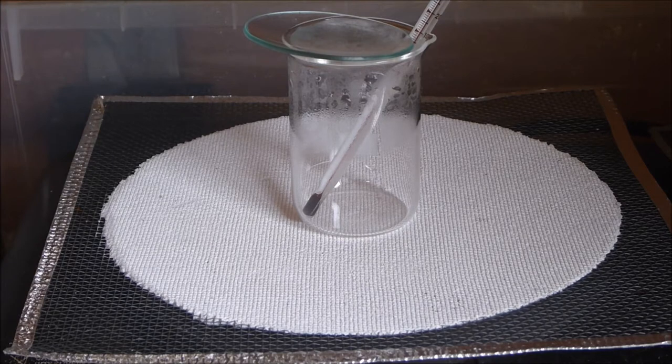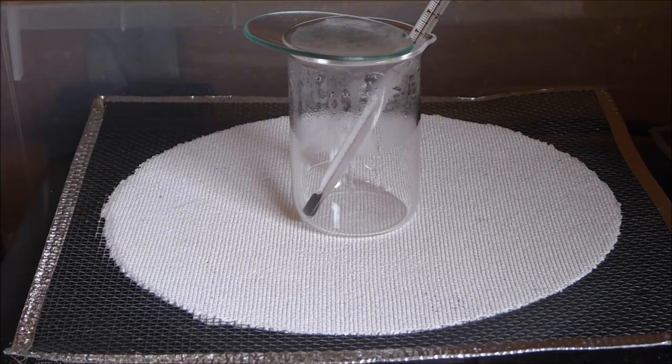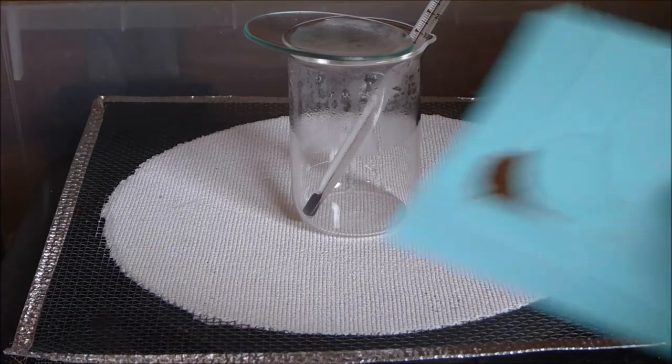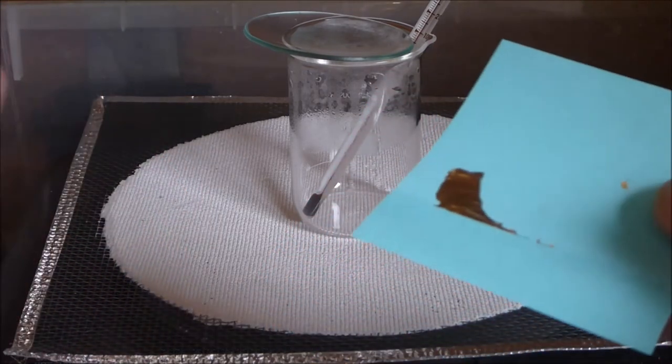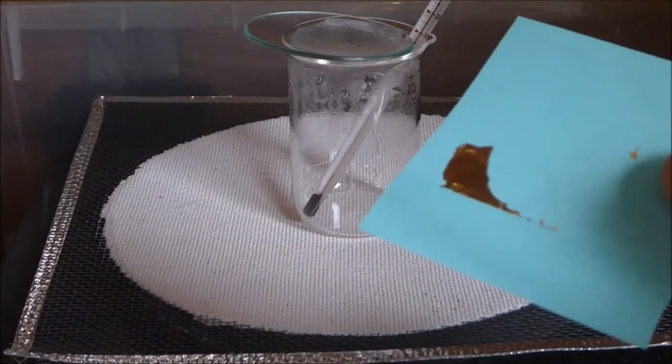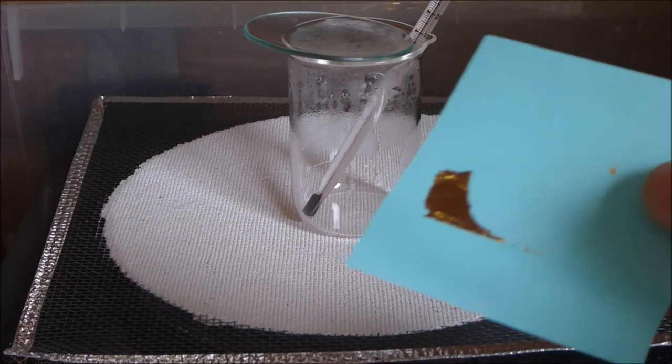I figured we might just quickly dissolve a little bit of it and do a stannous chloride test and see how the color comes up. I'll just get all this into the little beaker here, then we'll put some hydrochloric acid in, maybe about one drop of nitric acid in, watch it dissolve and let's see how the color comes back.